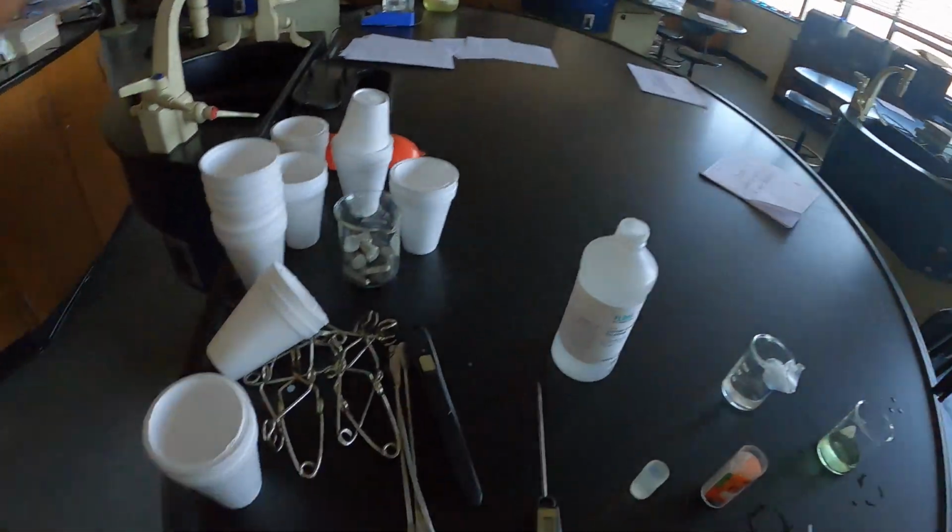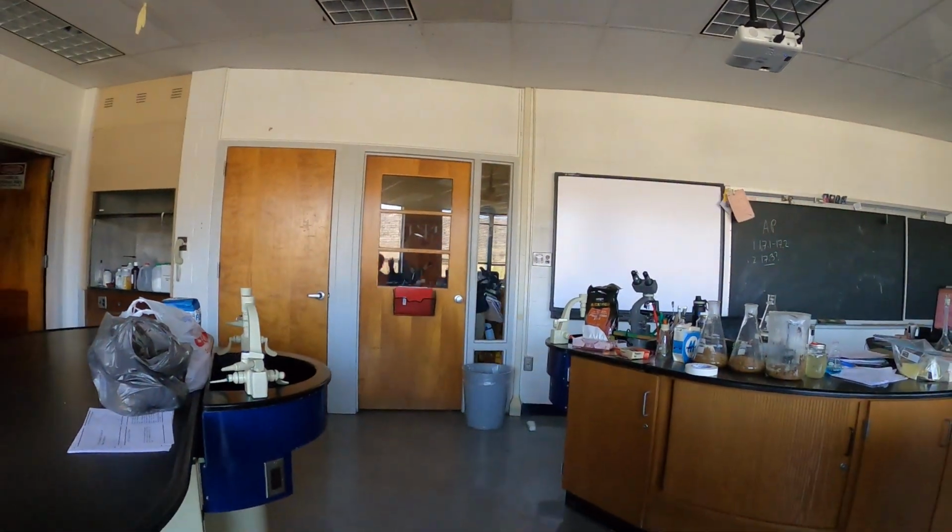So I'm gonna put this in my 7 buffer. Here you guys are waiting to come in while I finish my video.